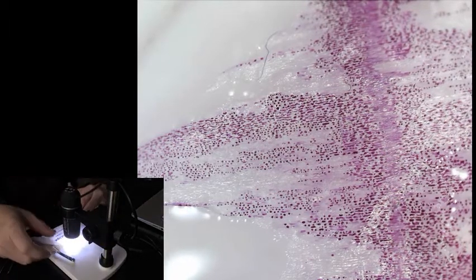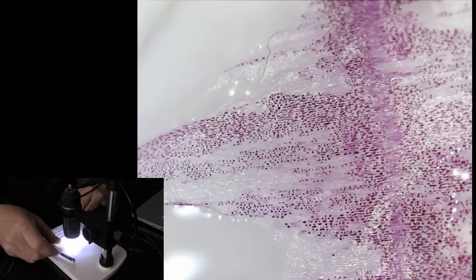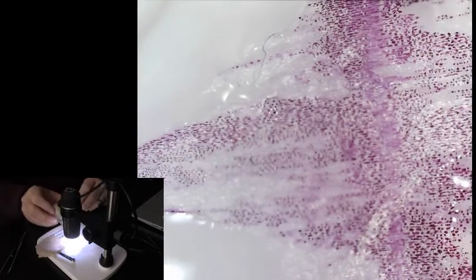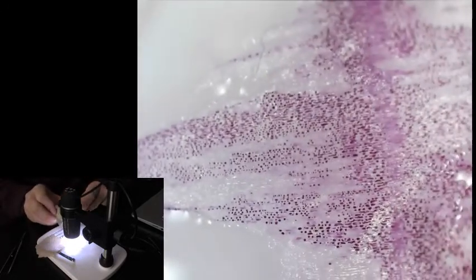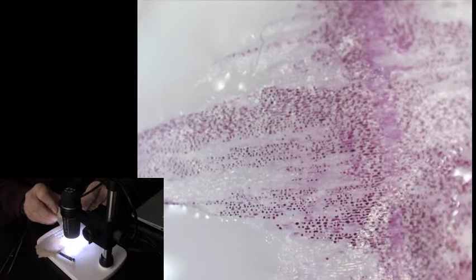There's the cells that were washed with salt water. The cytoplasm has shrunk up, the cell membrane has pulled away from the cell wall. And this time, instead of using salt water, I'm going to use distilled water.